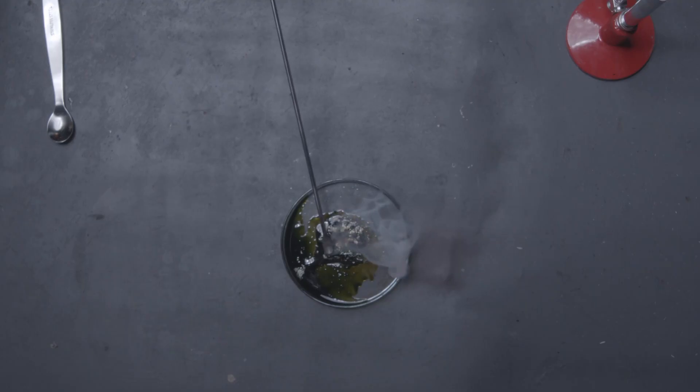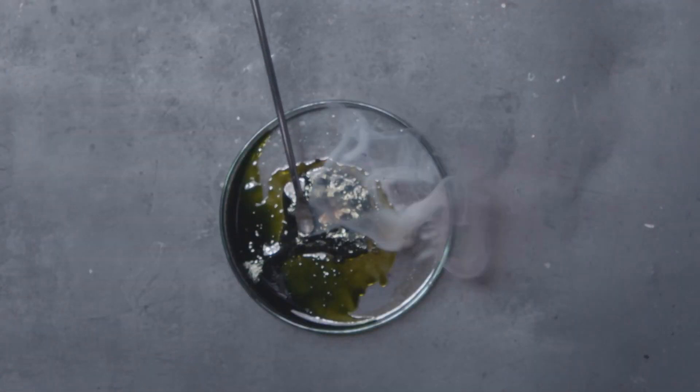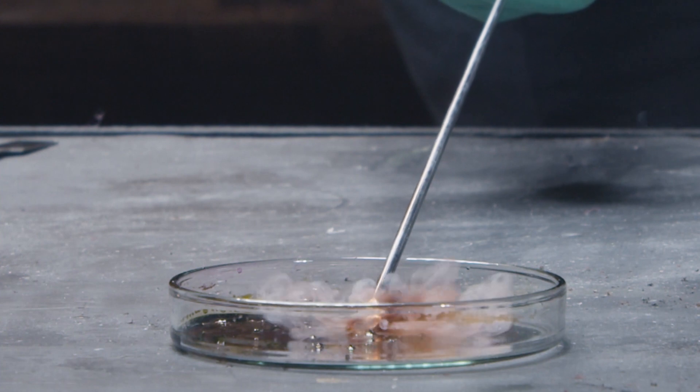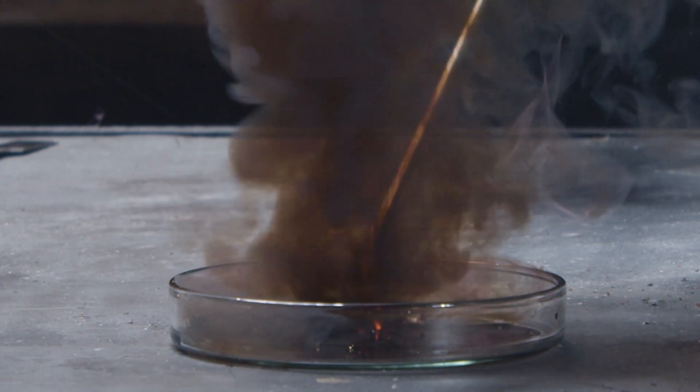Now that we have it in front of us, let's touch the top layer with a metal rod. Do you see how that green oily thing on the top almost instantly went up in flames? Well let me show you that in slow motion. That is manganese heptoxide for you.